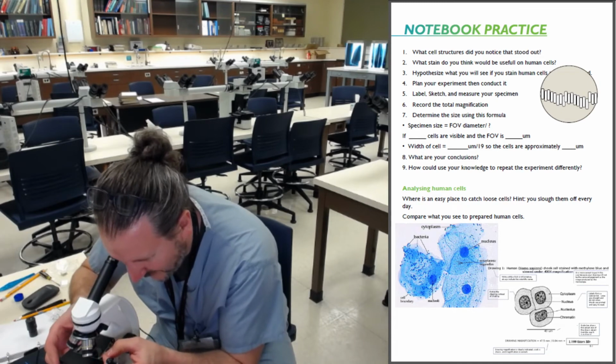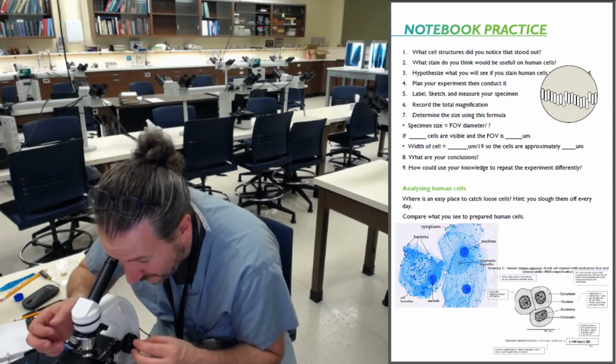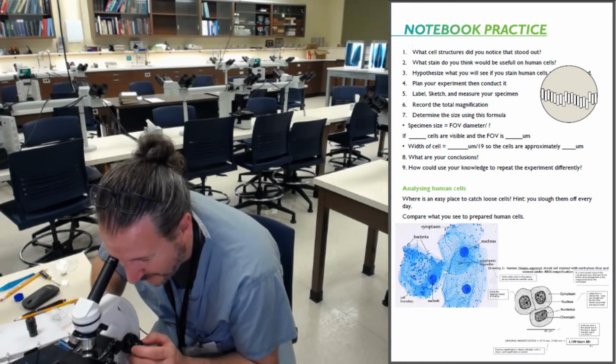You should be doing the same thing with your scope right now. Big old bubble. Always on the fine tune.